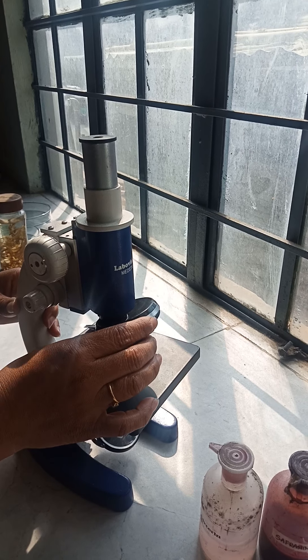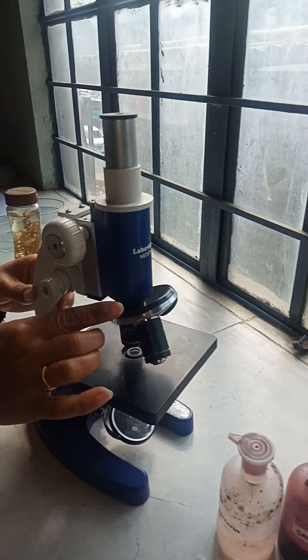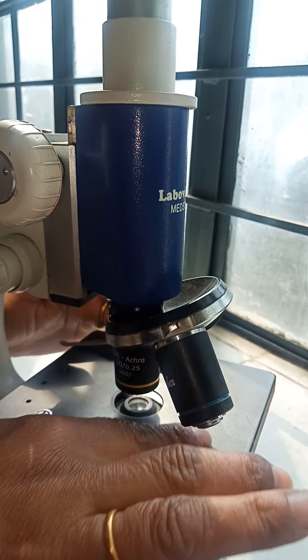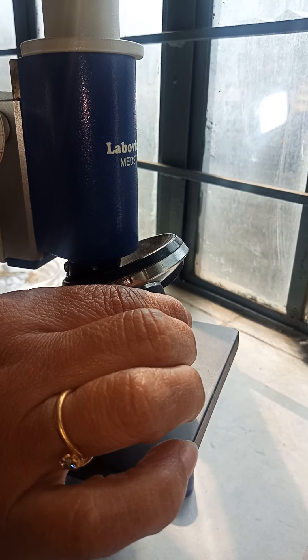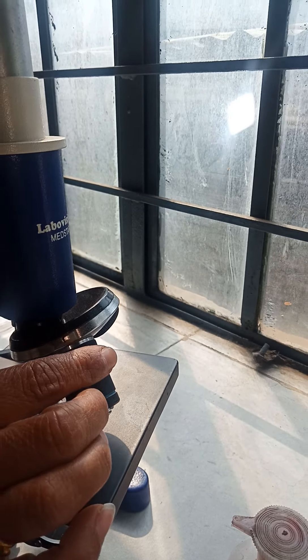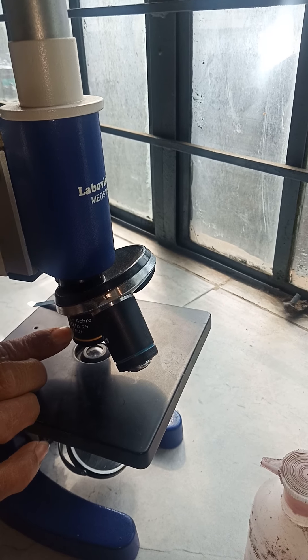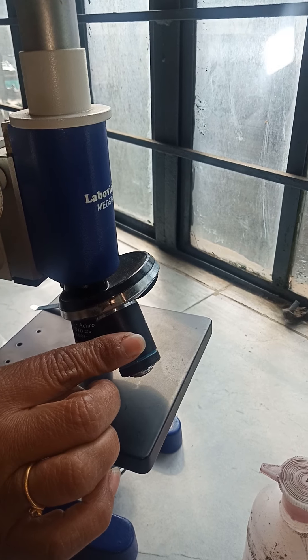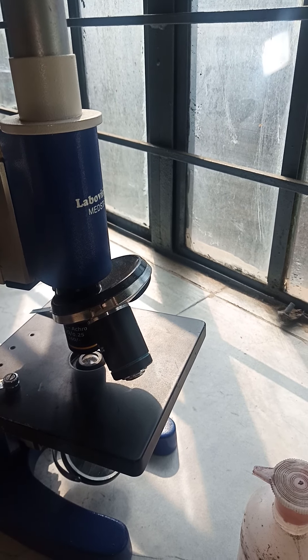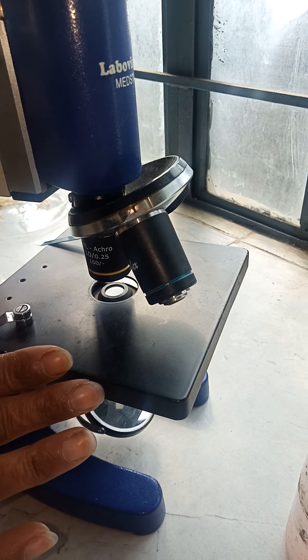Below the eyepiece, there are lenses. In this microscope there are two, but in a typical compound microscope there are three types of lenses: one at 10x power, a second at 40x power, and a third at 100x power. The 10x is called low power; 40x or 45x is high power; 100x is also high power. For observing algae, the 10x lens with the 10x eyepiece is more than sufficient.